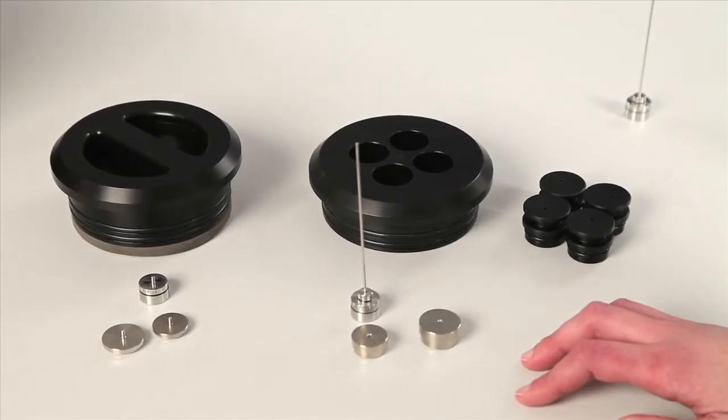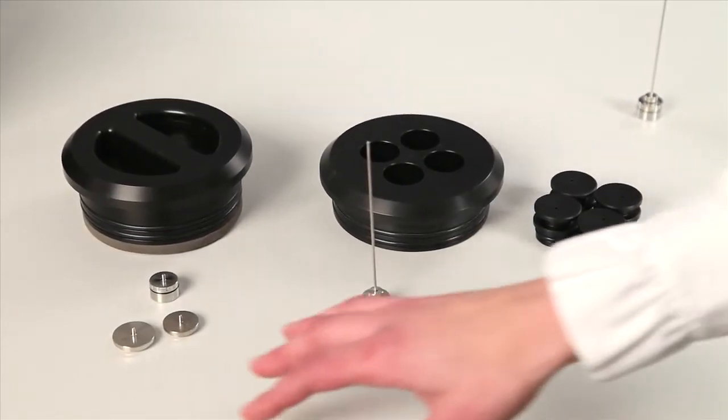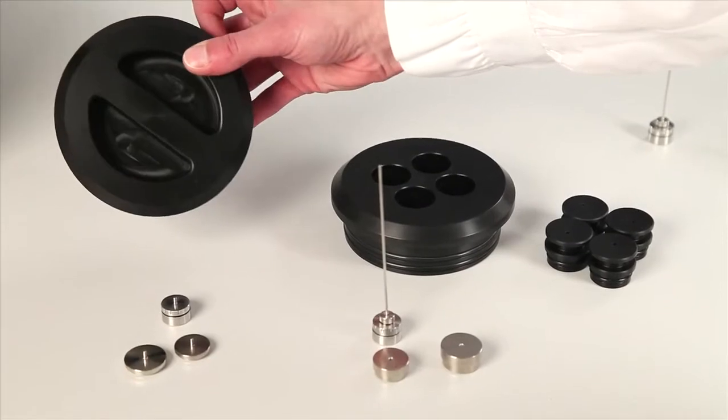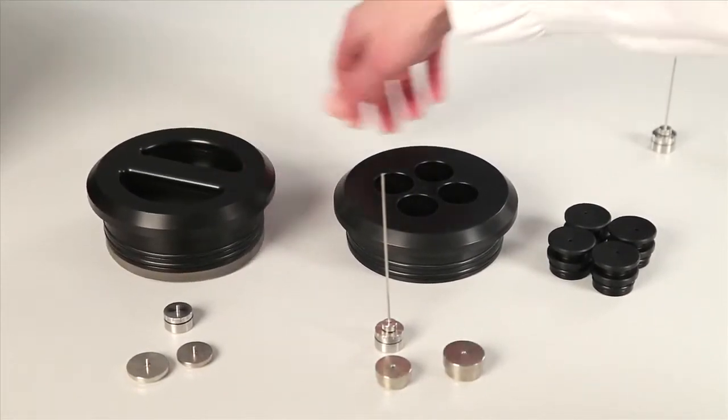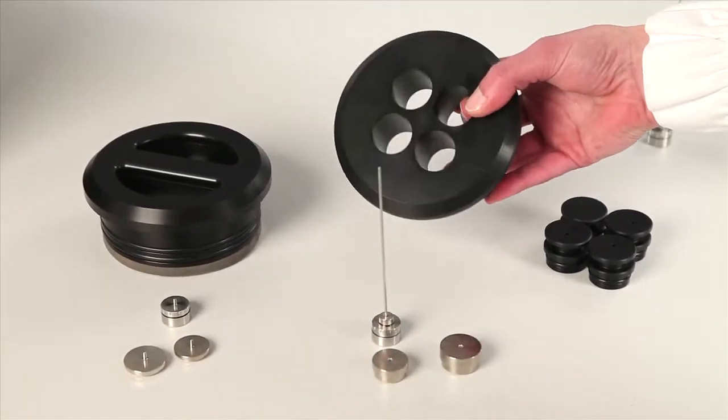There are several differences between the batch setup and the standard setup. For example, the standard lid is solid, and the batch lid has access ports.